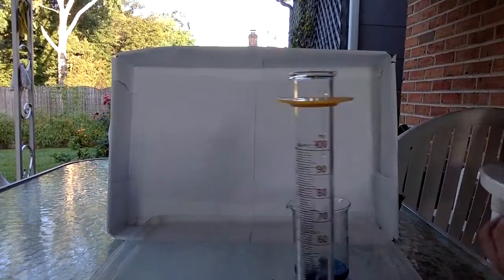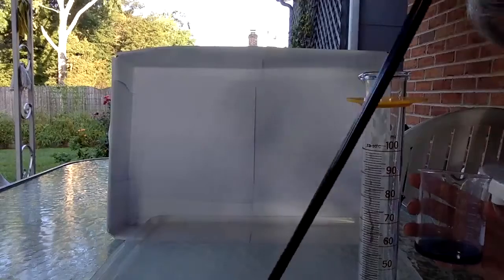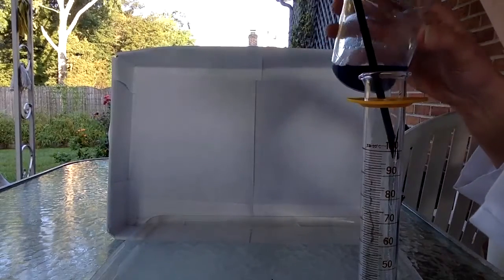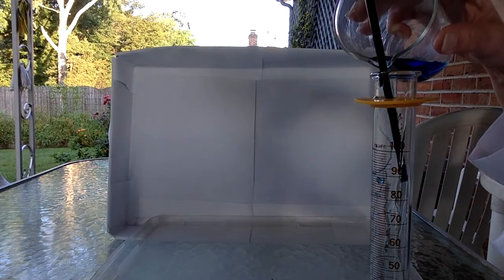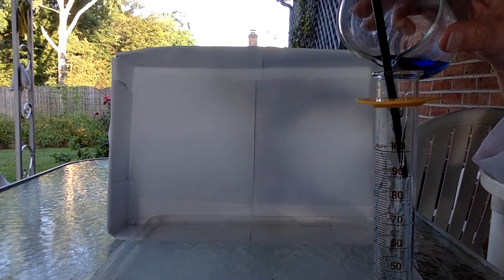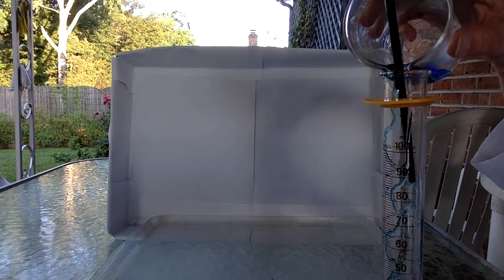I mean the density or the volume, either one. Now I'm going to use this chopstick and put it here, and then pour the water down along the chopstick so it flows more slowly in, because water and corn syrup can mix, and I want to minimize that.